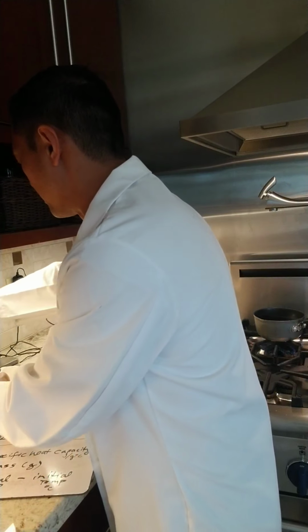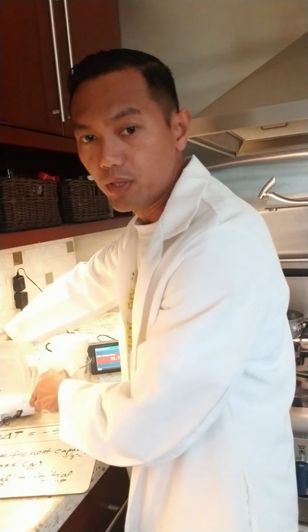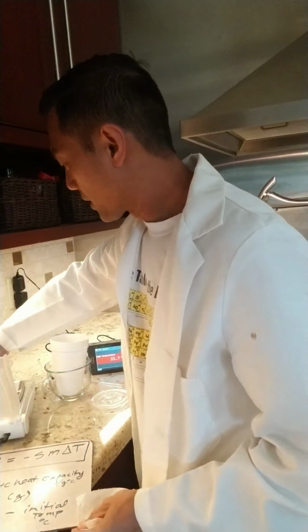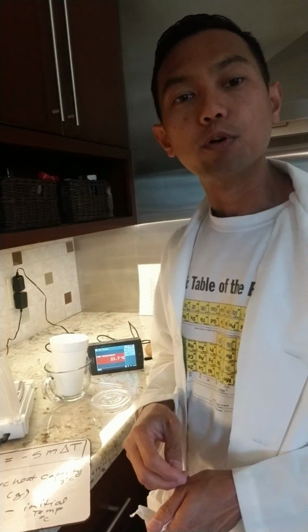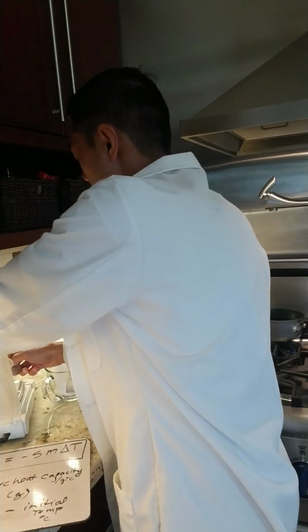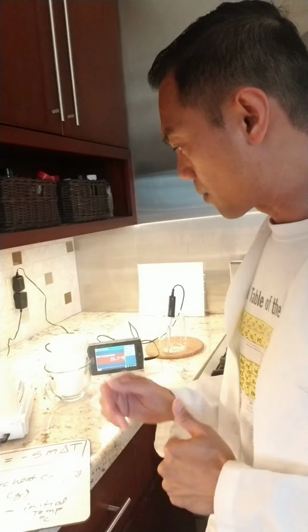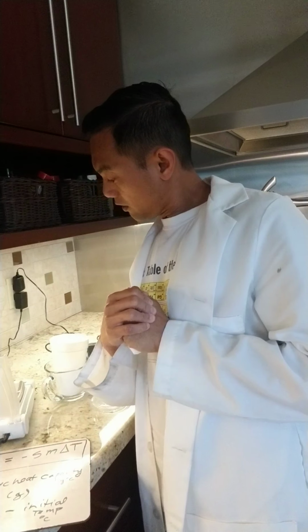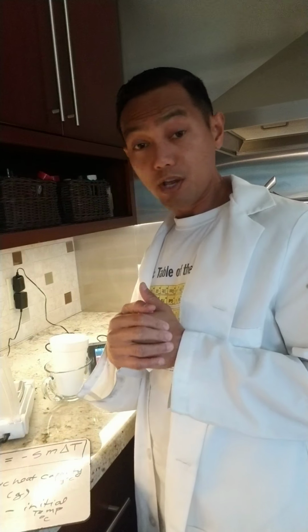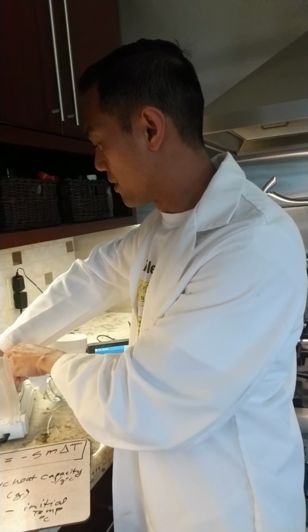And what I'm going to do is move this away. Part of this, again, is the mystery of you not knowing what the metal is. We're just basing identification on our data. So right now, I'm going to zero this. You can hear it dropping onto our scale there. It looks like the weight of sample A is 31.28 grams. Okay, again, let me hide our metal.